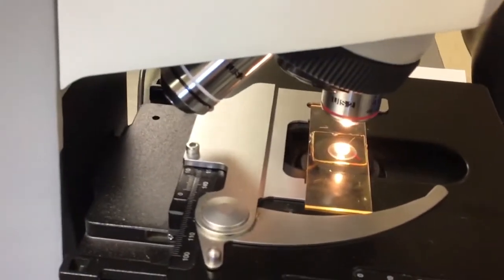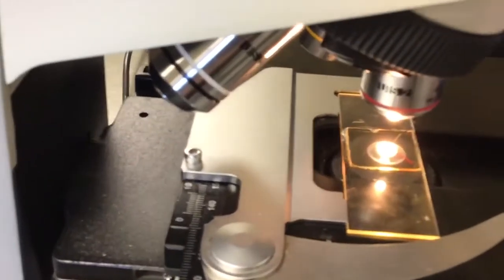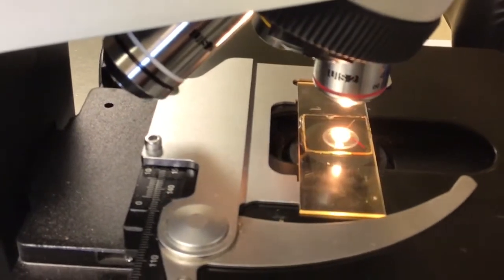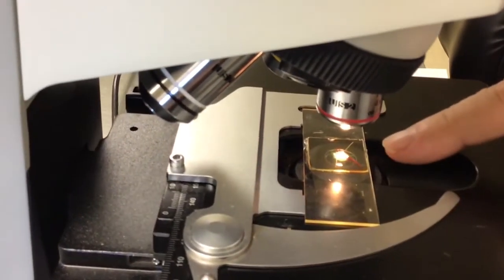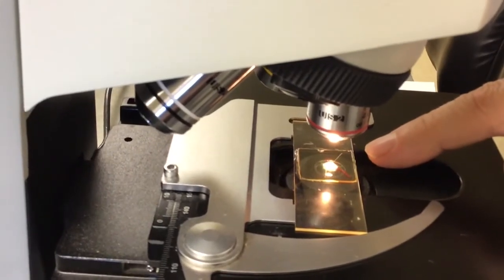Now, underneath here is a little tab. If you look up here though, don't look at the tab so much, just look here. You always fumble for the tab, you feel for it. It opens an aperture inside that's called your iris diaphragm, and you can open it and you can close it. And I'll show you a little bit later what that does to what you're looking at. Now notice at this point that when I open it, it lights up those three threads. Just come back to me.